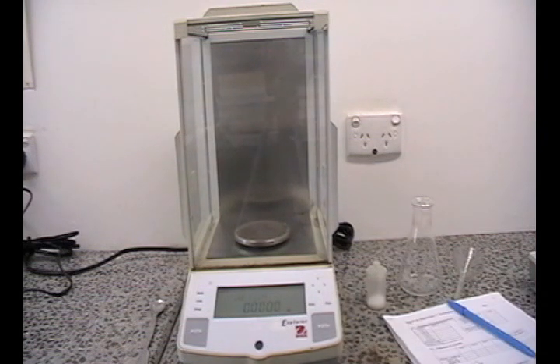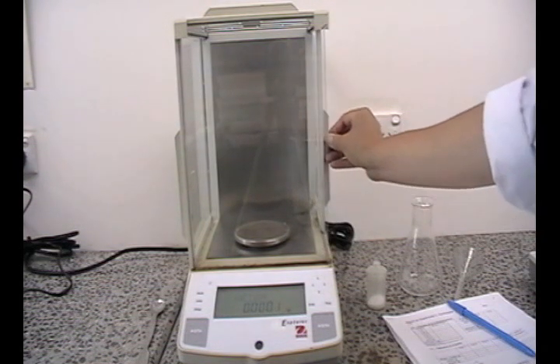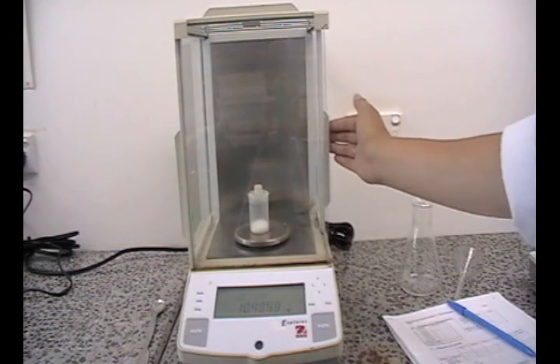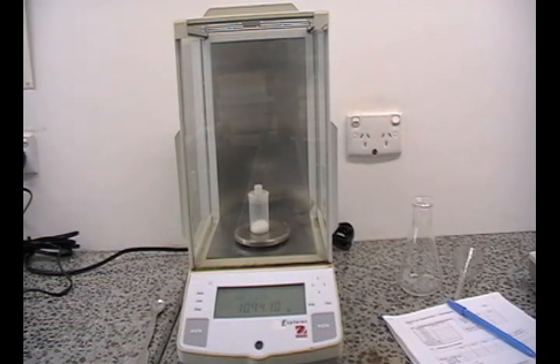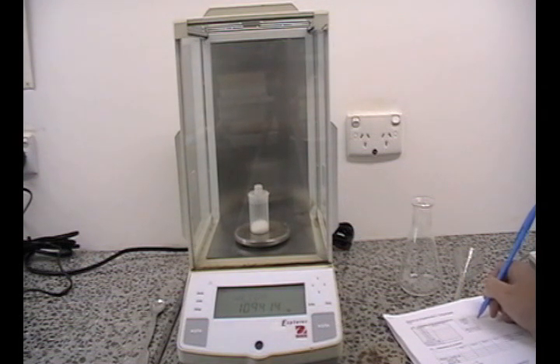When you have a stable reading, gently open up one of the side doors and place your substance into the balance. Gently close the door. Wait for the balance to stabilize. And when you have a stable reading, record your result. Make sure that you include all the numbers that you see on the balance. That includes the zeros.